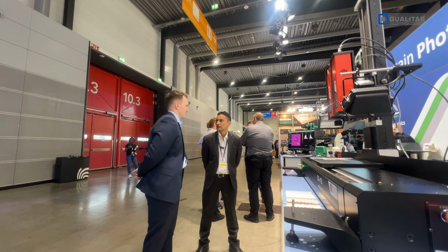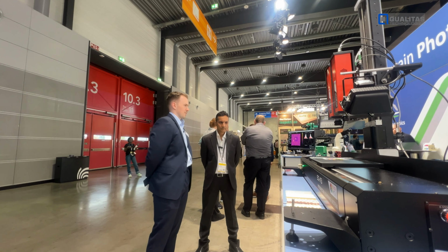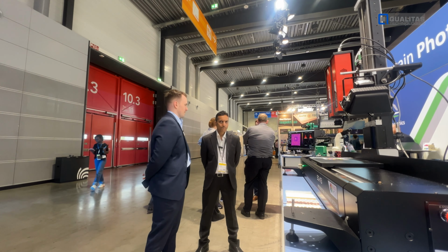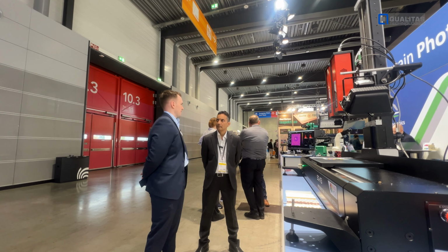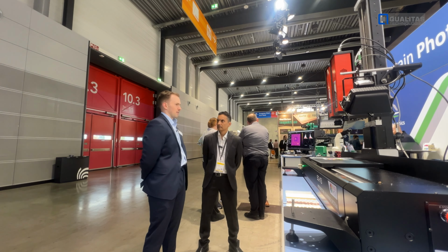So you can do those spatial measurements, but you can also do chemical measurements. In the infrared, for example, here we have various different types of rubber and plastic. You can easily differentiate different types of plastic based on different polymers. Even if those types of plastic are visually exactly the same color, if they're a different type of plastic, it's easy to differentiate with the infrared.